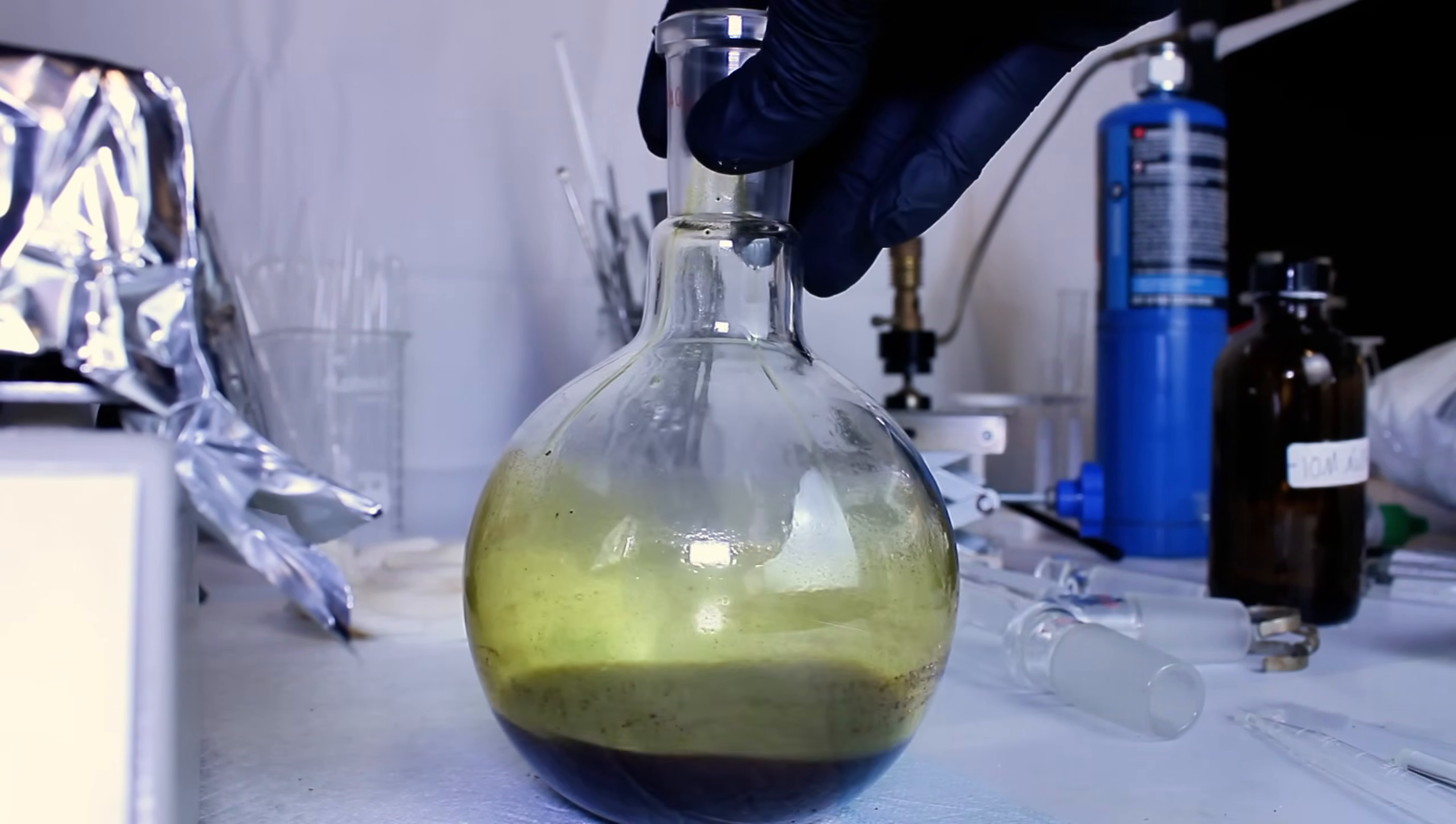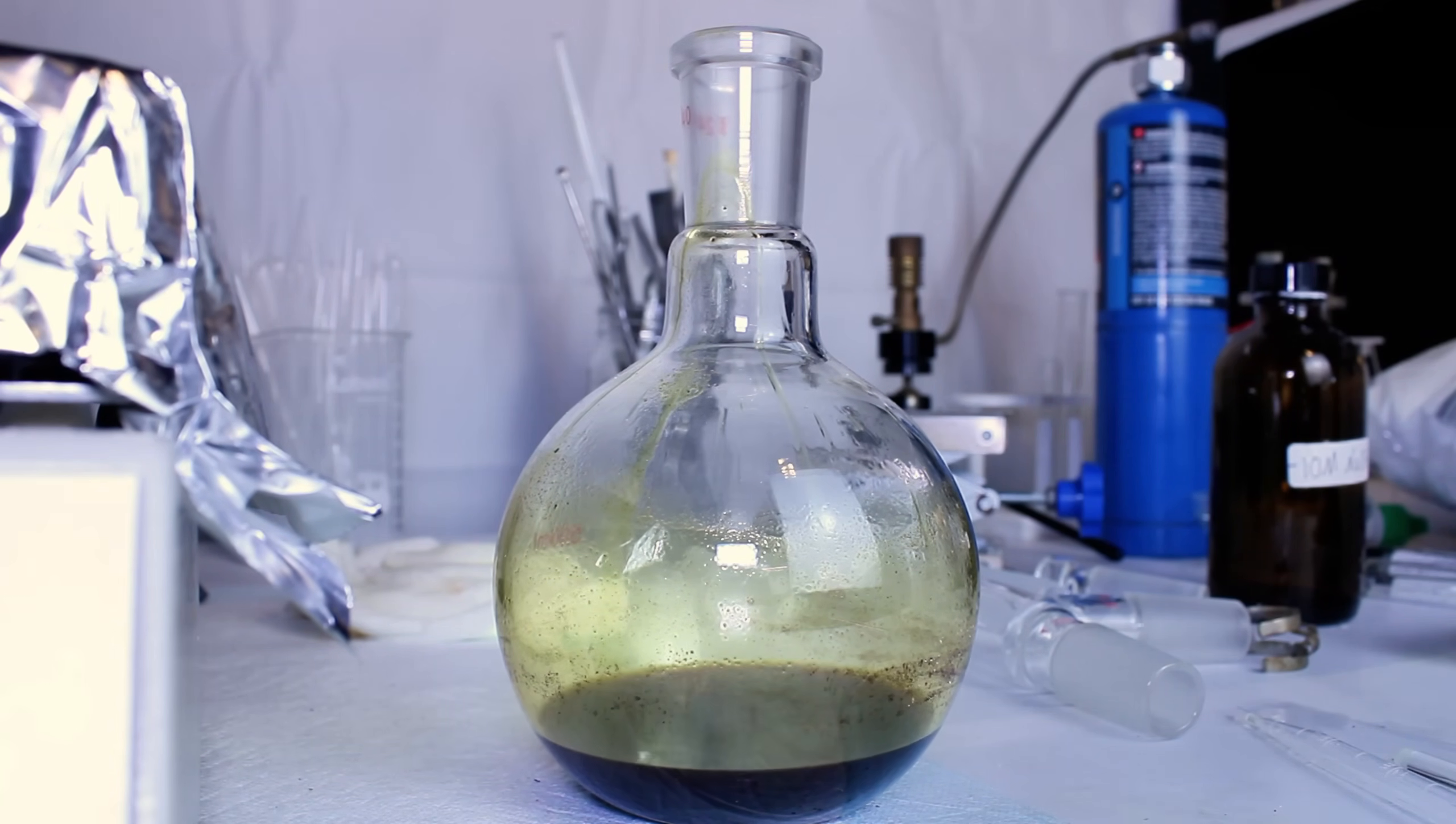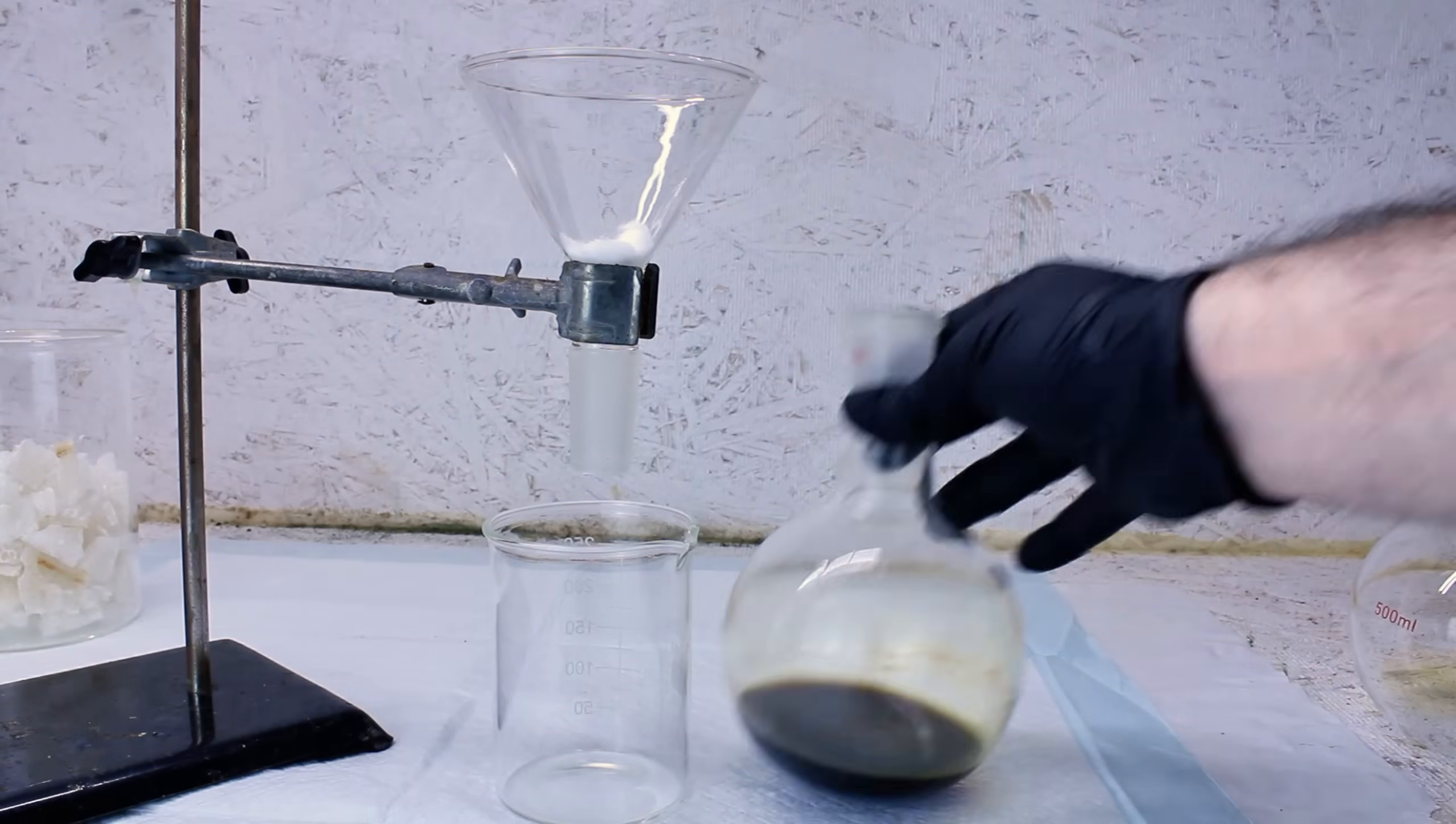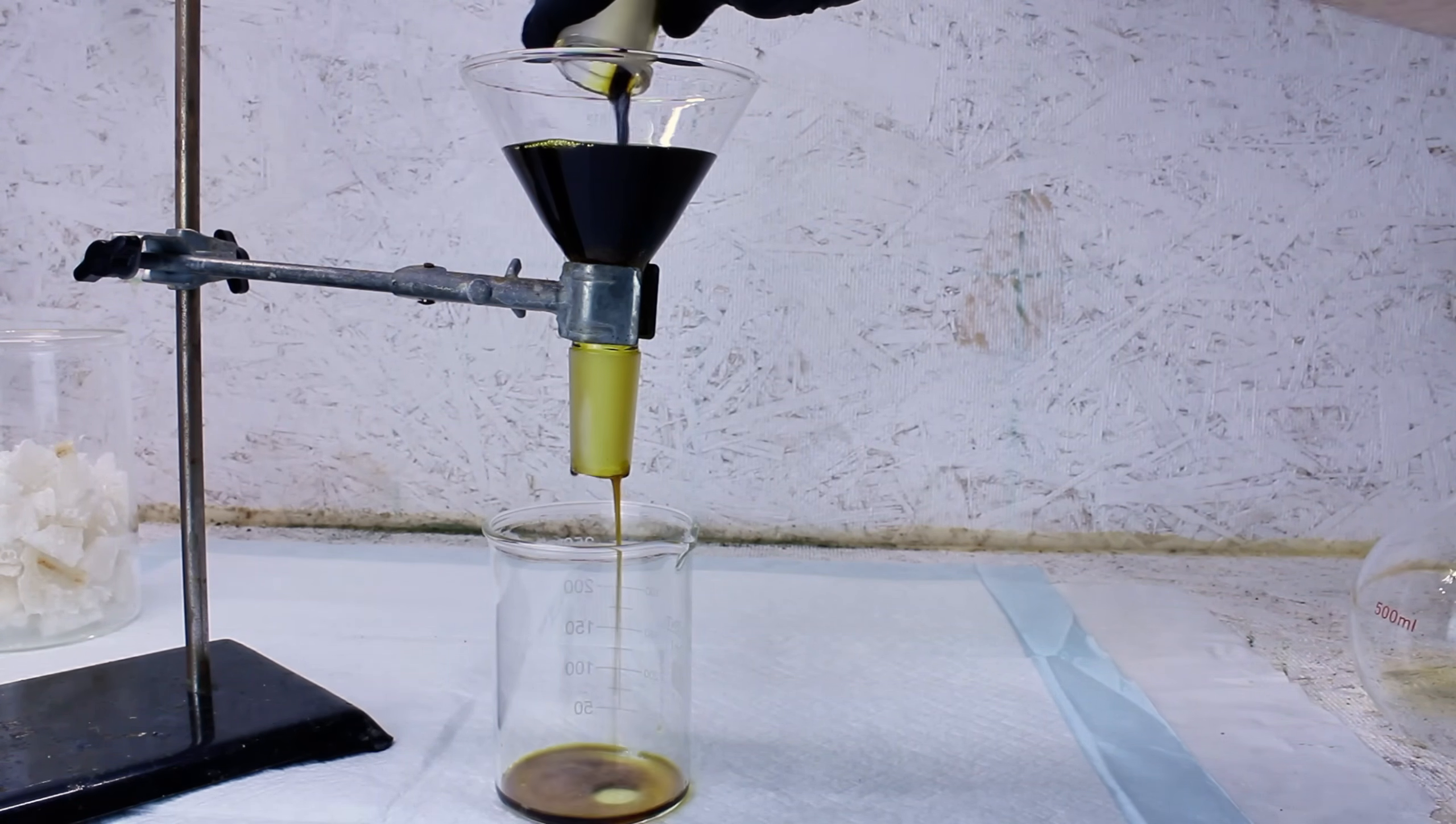This will saponify most of the fats and oils present, while most of the secondary alkaloids present, besides piperine, should be made insoluble in isopropyl by this step. To that end, I stir this for a few minutes and then pass the solution through a cotton ball to remove all the precipitate.